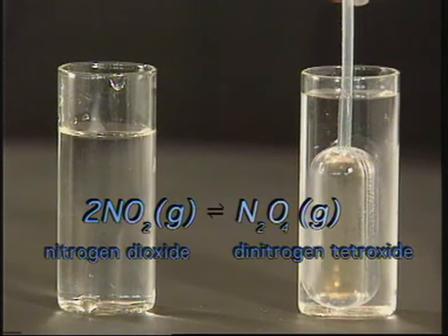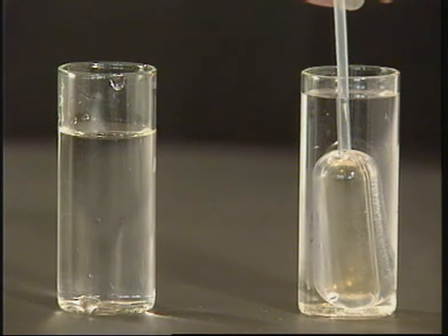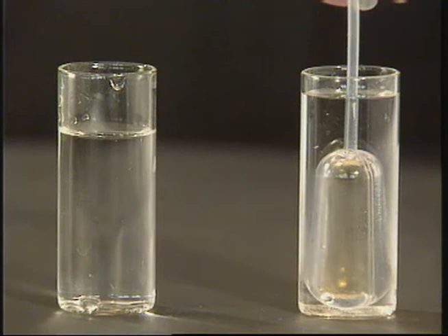At high temperatures, the concentration of the nitrogen dioxide is increased and the gas appears dark brown in colour. At low temperatures, the concentration of the colourless dinitrogen tetroxide increases. At this temperature, there is still a small concentration of brown nitrogen dioxide present in the propette. The gas mixture therefore appears light brown in colour.